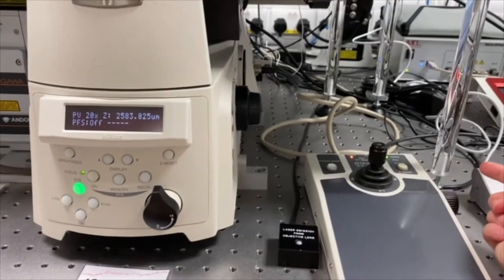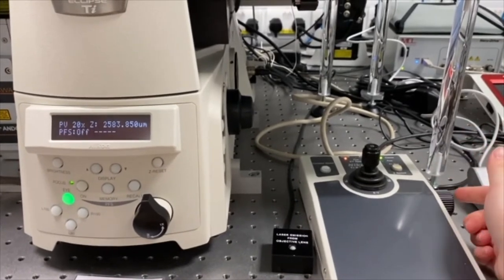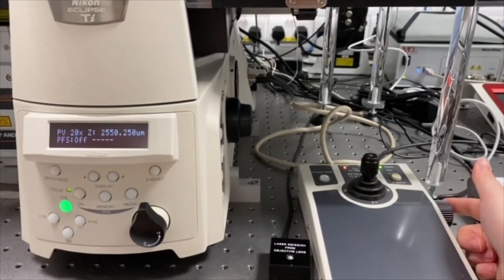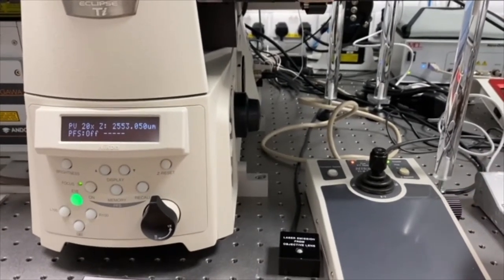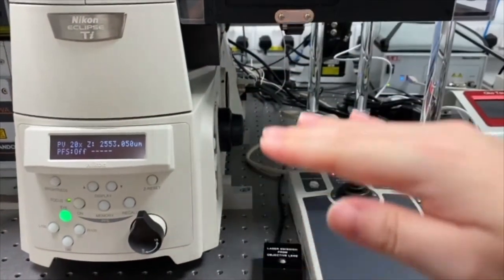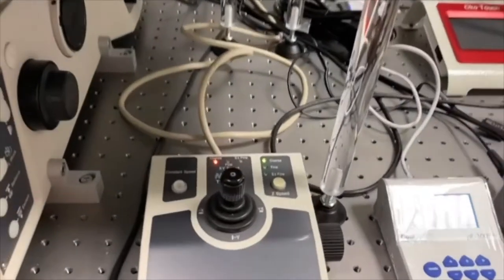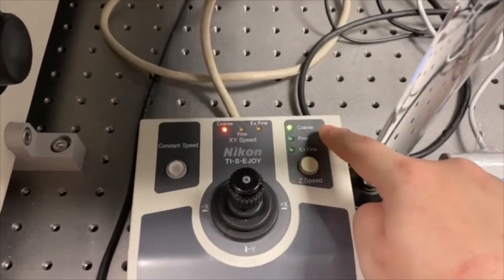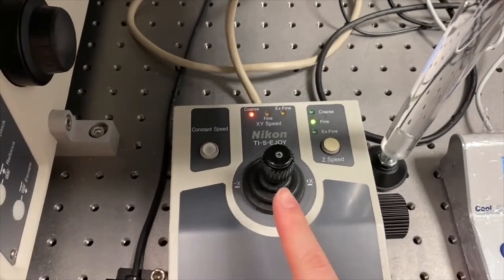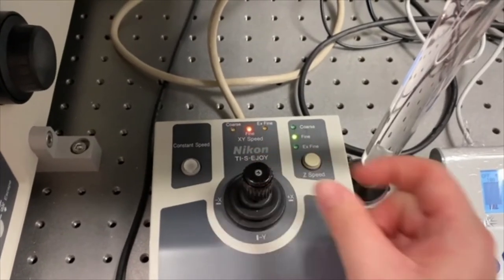When the indicator lights up green, if you've overshot just carefully go back down until the focus indicator just goes off, then bring it up a little until it just comes on. This is because when it just comes on you only have one direction to look in to get your focus. Once that light is on, get into the habit of changing everything to fine — press the button until it says 'fine', and twist the joystick until it also says 'fine'.